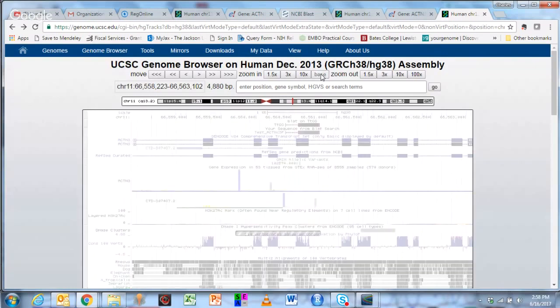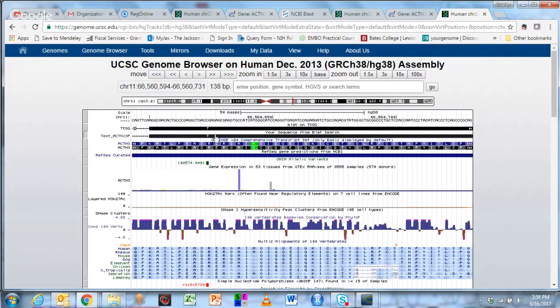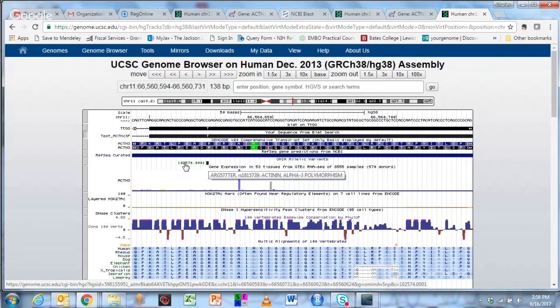I'm going to quickly zoom into base, which is at the nucleotide base level. So it's just zoomed down into our black bar here. And you can grab this and scroll, or move back and forth with these buttons. But importantly, you can see here, this is the amino acid sequence of the gene. And there's the arginine. R is coding for arginine. The reference sequence is C, G, A, and our sequence has a T. We know that this actually is a variant. It's highlighting that this is an allelic variant in the Online Mendelian Inheritance in Man database. So we could look up this variant in OMIM if we wanted to spend the time.